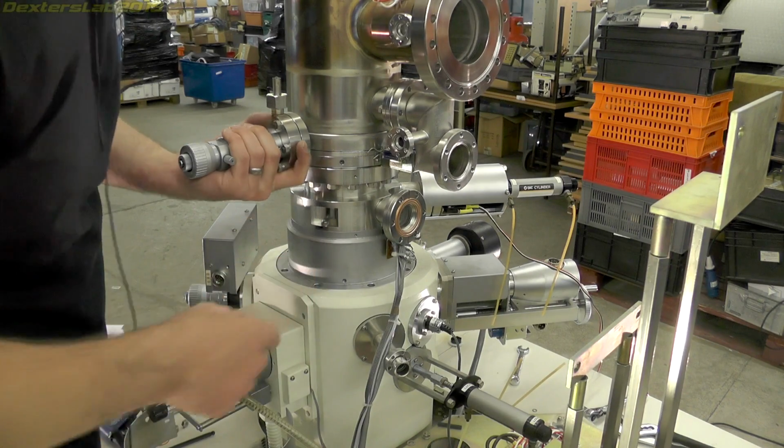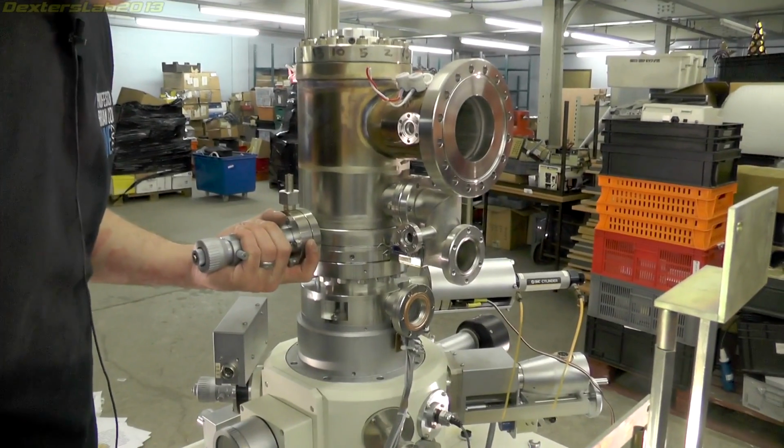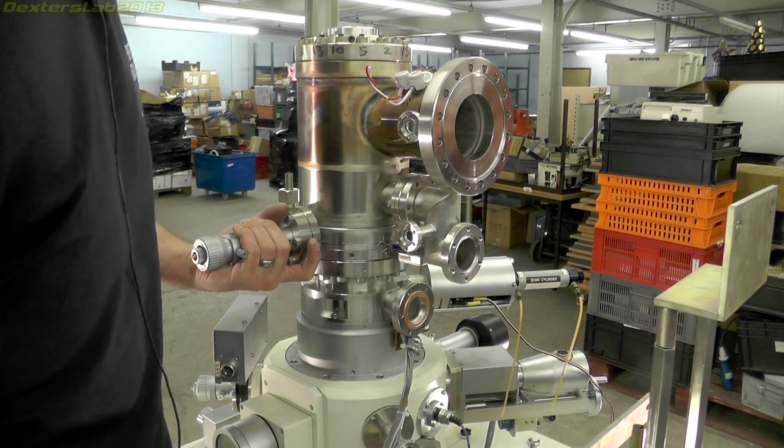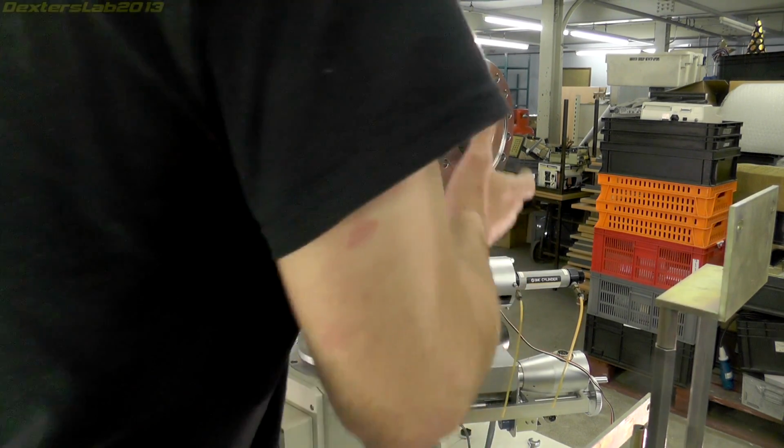Now, what I want to do before I actually remove this completely is just to see how heavy it is, because I don't want to end up picking this up and then having to drop it.